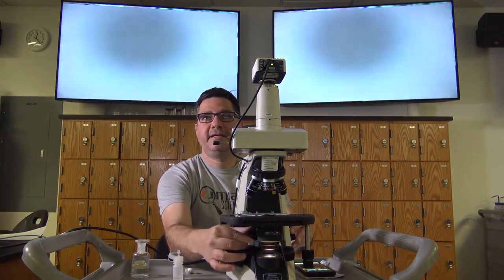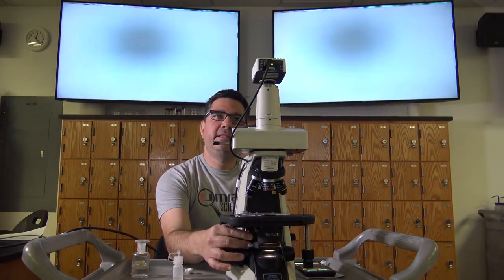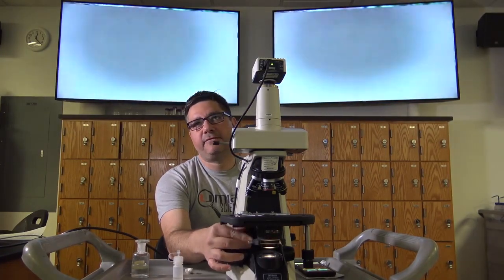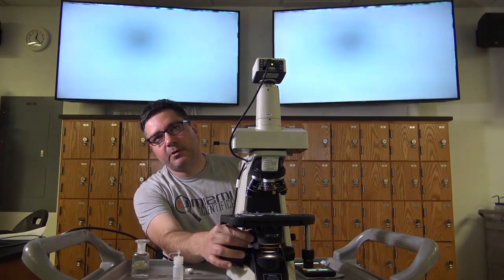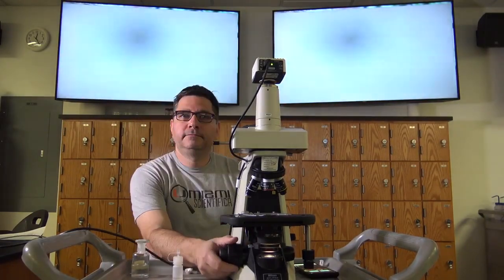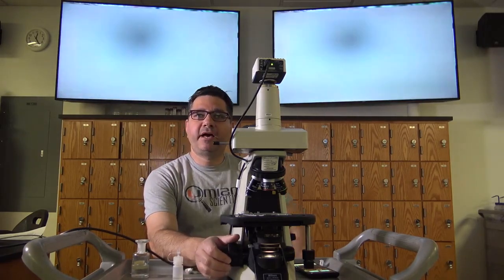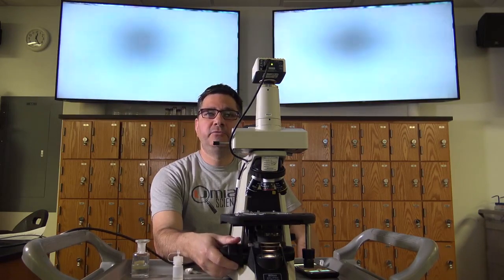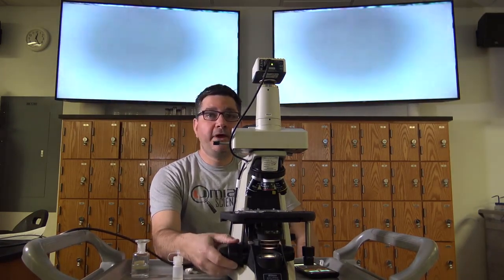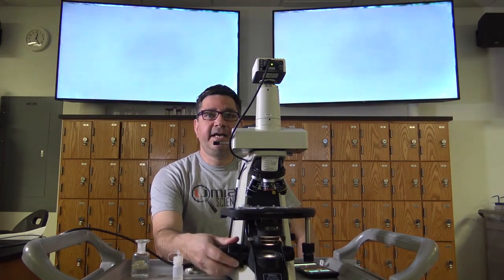Now, as you can see on the screen behind me, there's a dark spot in the middle. So I can adjust for this by simply lowering the condenser, which I'll do right now, which is a little better. While looking through the eyepieces, try to keep both eyes open. Rotate the coarse adjustment knob slowly to raise the stage. Once you are able to see the specimen, it usually looks like speckles on the slide.